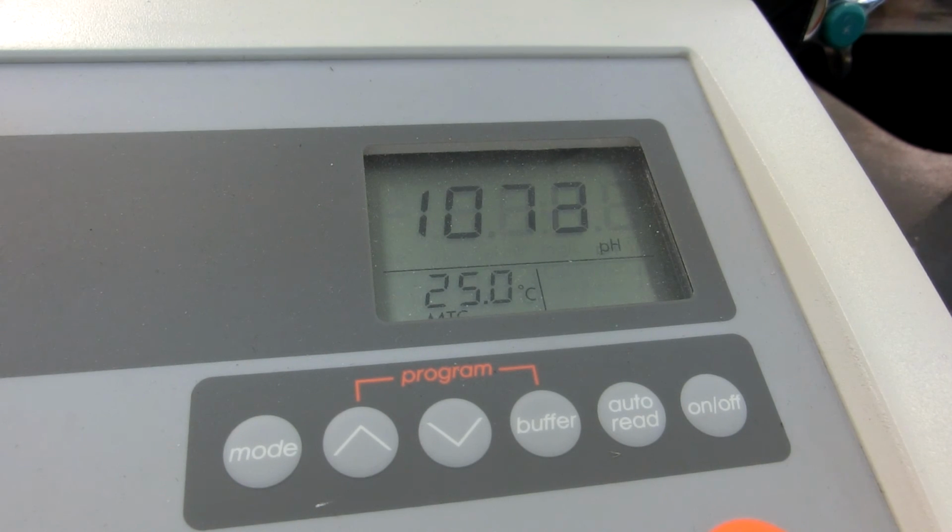I think that seems to be a convenient place to stop. This was part 2. Again, strong acid of around 0.1 molar hydrochloric acid, which we can determine the concentration from the pH curve, a titration curve. Titrated with the sodium hydroxide we standardized last week using a pH meter.